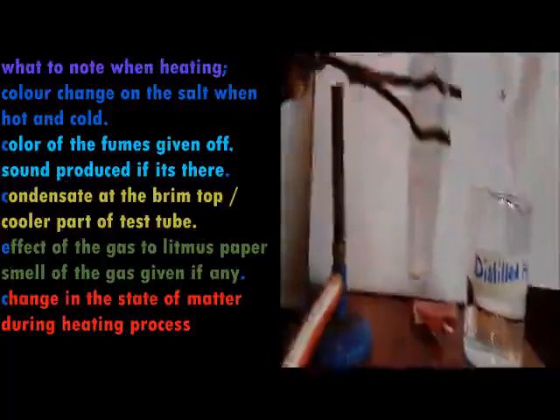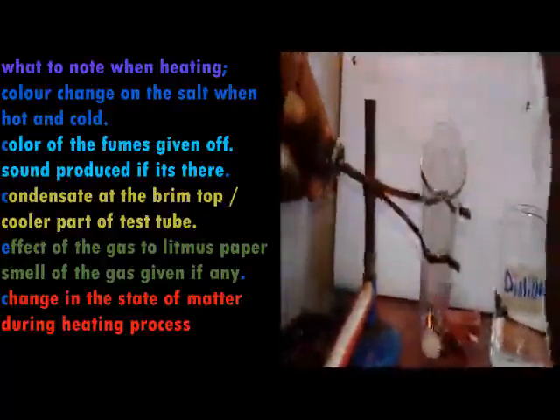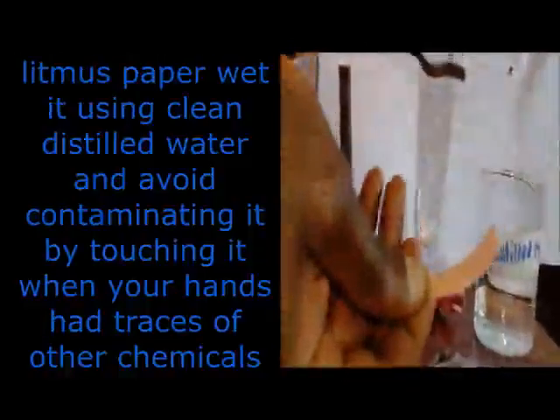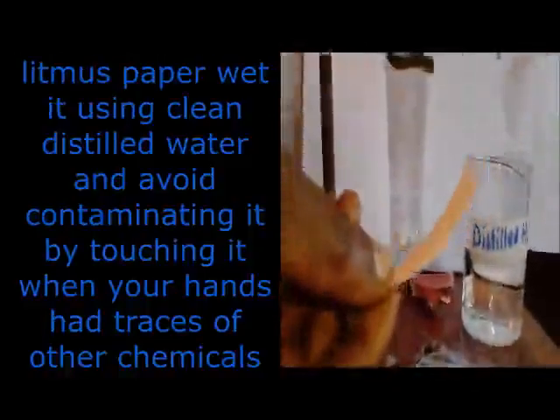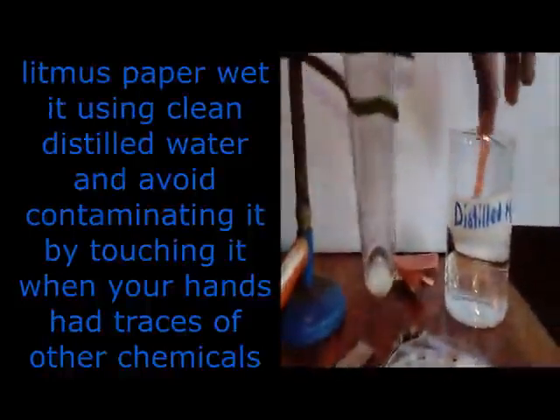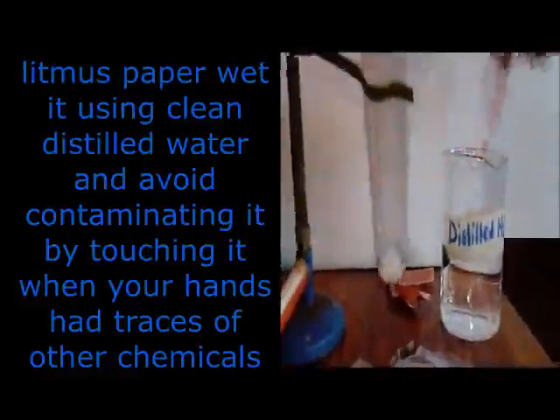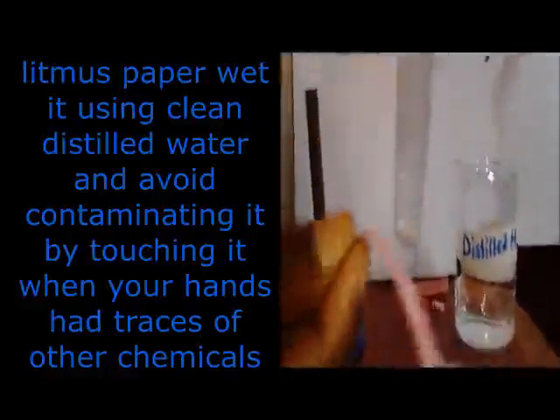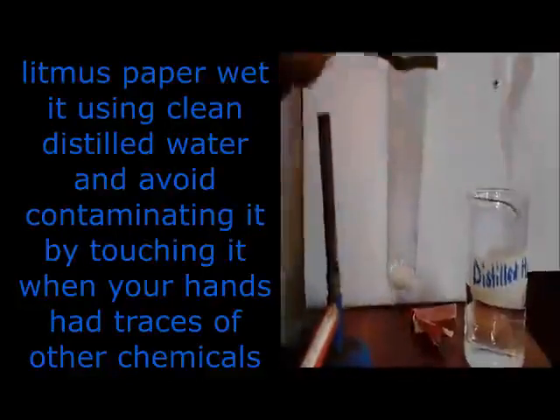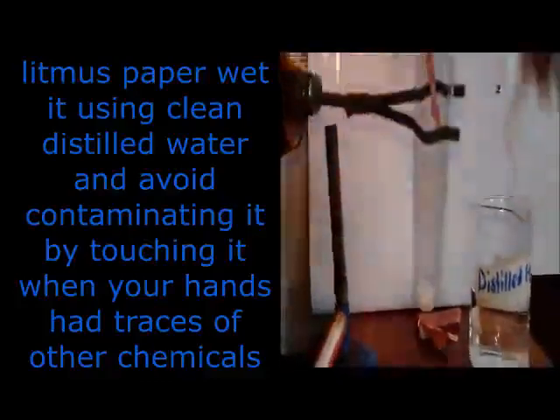So after doing that, you get the litmus paper. Then you dip it in distilled water. So you get a red litmus paper, you dip it, then you put it on the top of the boiling tube. Then secondly, you get a blue litmus paper, you dip it in distilled water. Then also you put it on the top of your boiling tube.